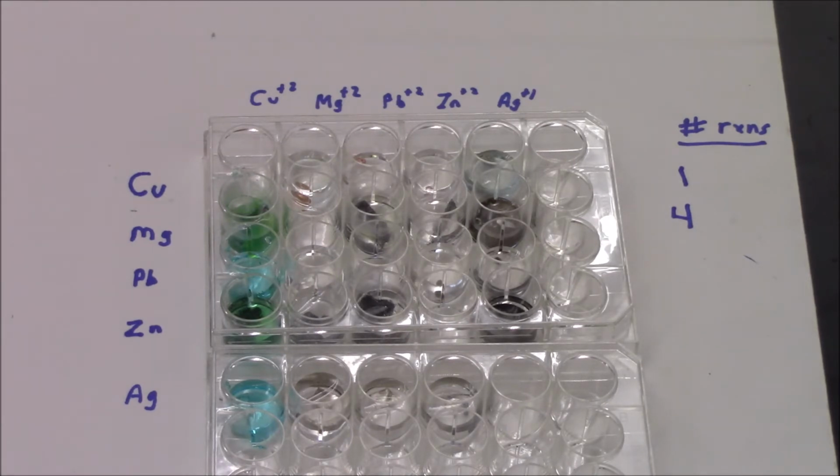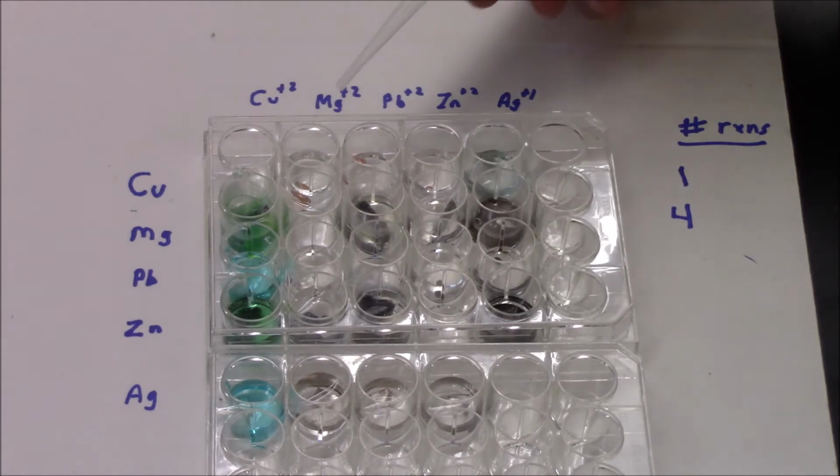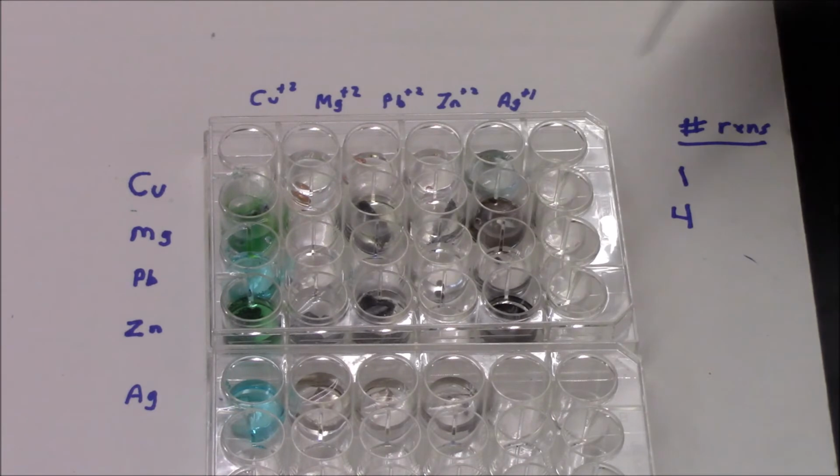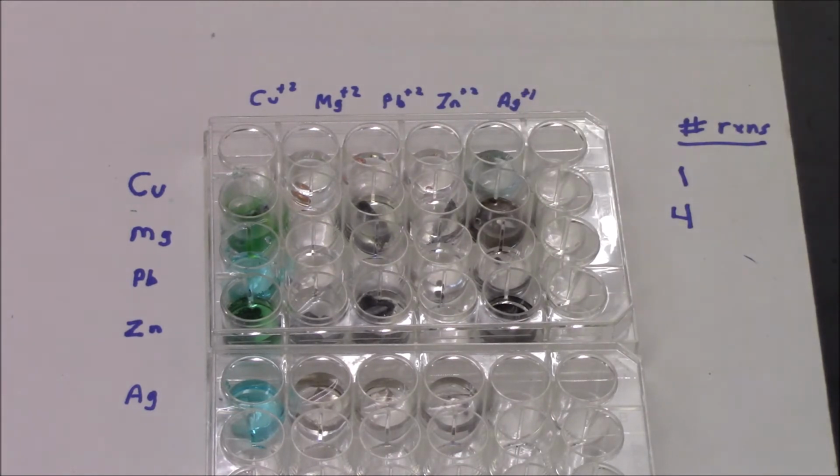And I think one of the first questions on the lab is arrange these from most to least reactive. And then what your job will be eventually is, for each one that reacted, you write a balanced equation. If no reaction happened, you don't have to write anything. You don't have to do descriptions. So the metals will always be solids. The solutions will always be aqueous. And in the next section, we're going to look at some other metals so we can see if we can expand our activity series.